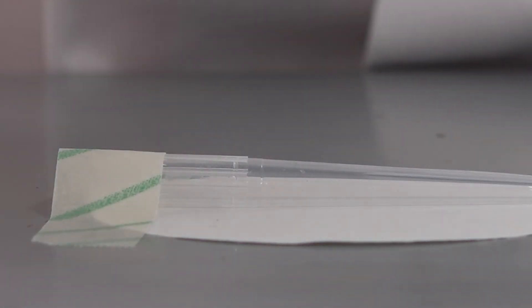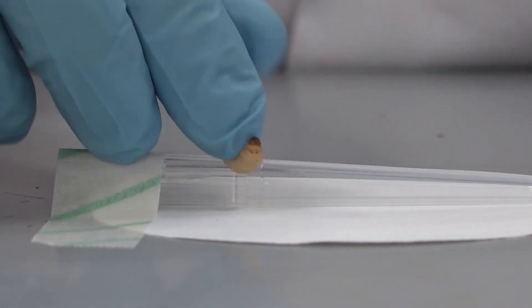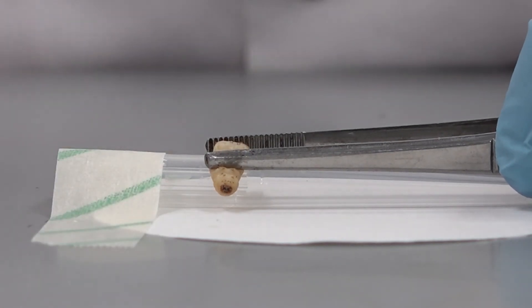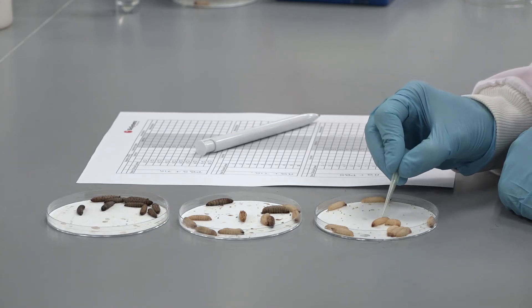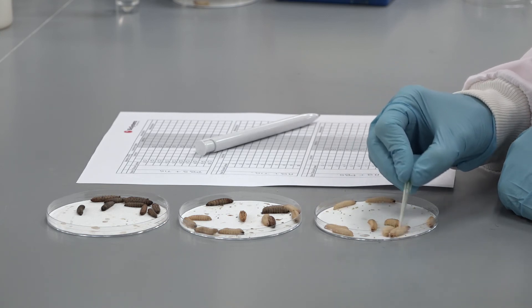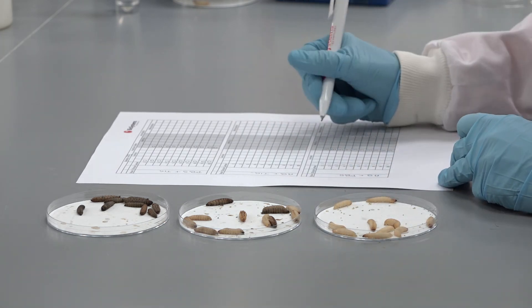As usual, a no-injection and injection control should be set up. Controls may also include assessment of the effects of solvents used to solubilise chemicals on Galleria mellonella. Larvae can be scored for morbidity at 24 hours, 48 hours, and 72 hours, and an LD50 for the chemical can be calculated.